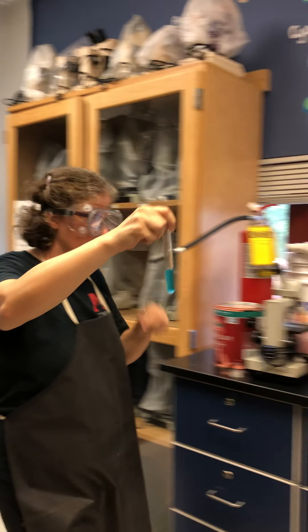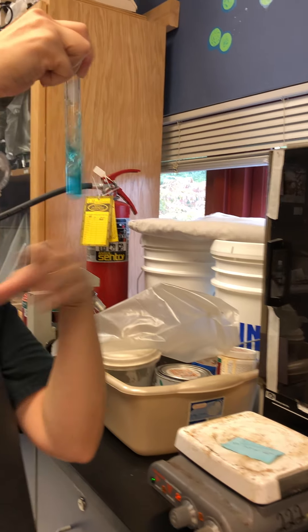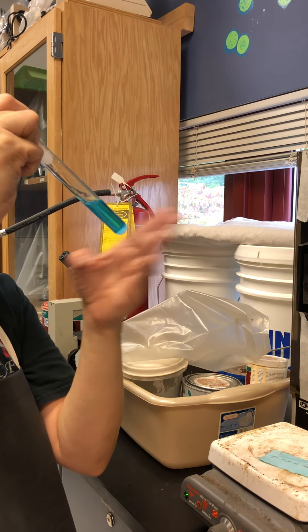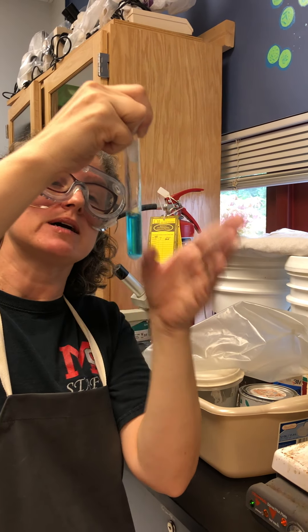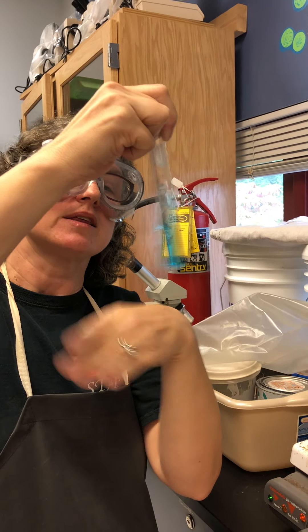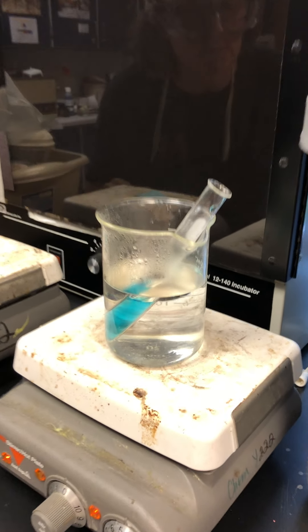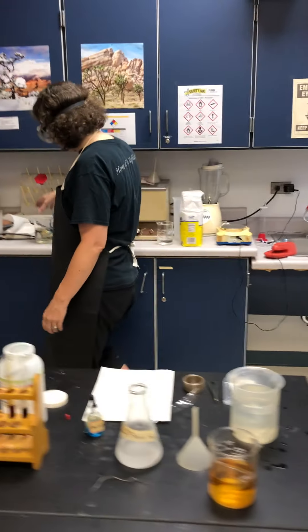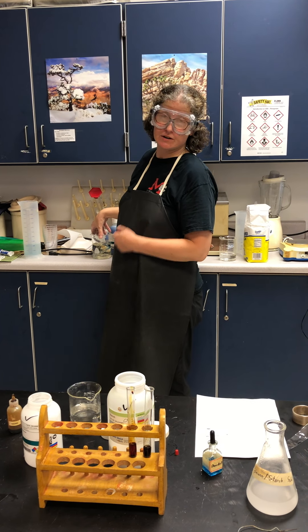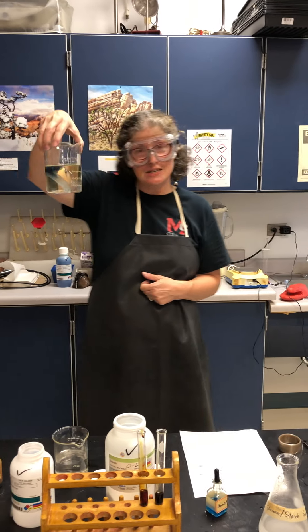I'm going to take it over to a hot water bath I have going. It will take some time for the color change to happen — it might take a minute. In the meantime, just like Julia Child used to do, we have something that has been sitting since this morning, much earlier, and look what happened to it.